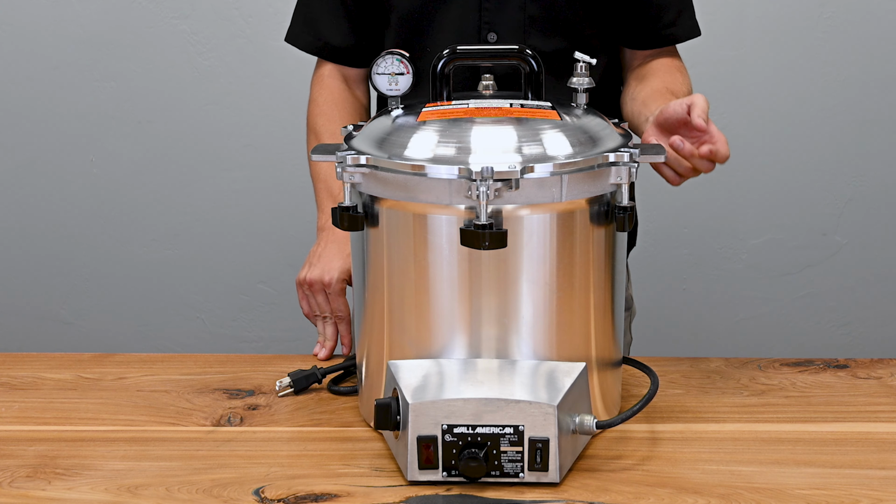Next, we will talk about the excess pressure relief valve, which is located behind the handle. Inspect for any dissolved mineral buildup. If there are any mineral buildups within the part, we recommend replacing the valve with a new one. We recommend replacing this valve every 3 years in normal service.